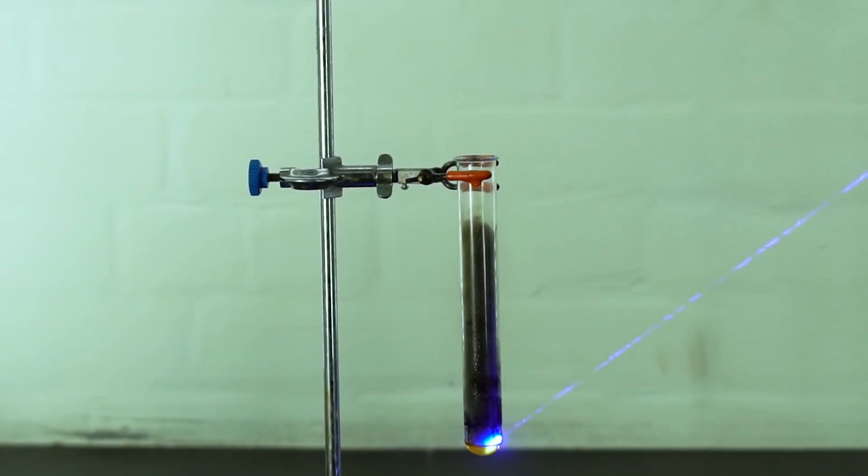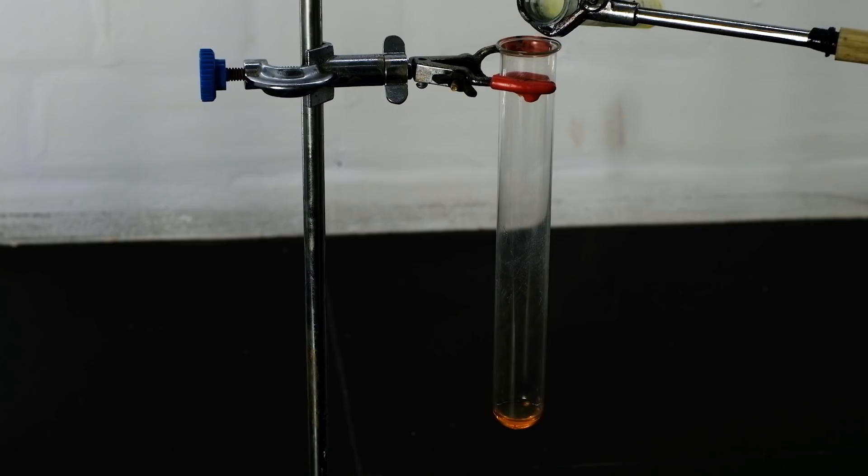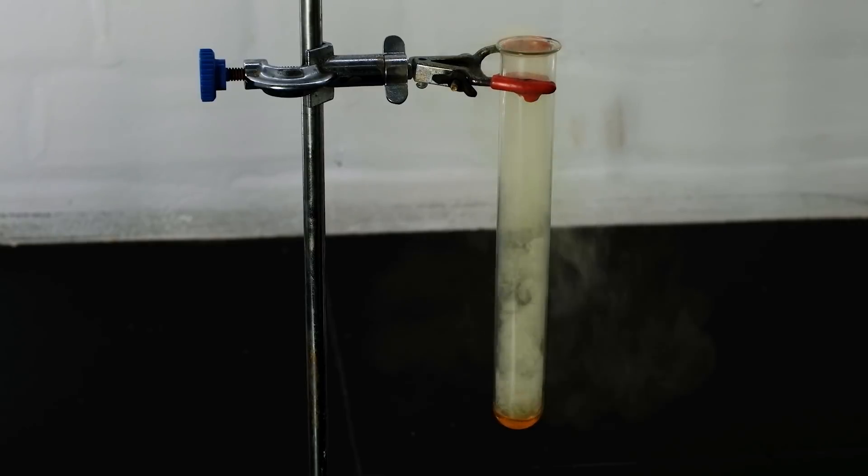Photochemical reaction occurs at the phase boundary. Let's repeat all the actions, but this time I will guide the laser beam from the top to the bottom.